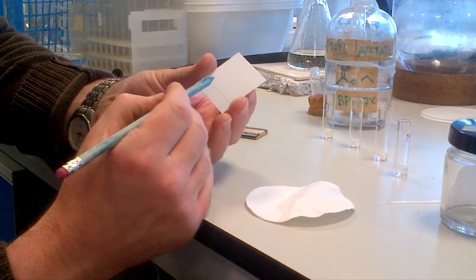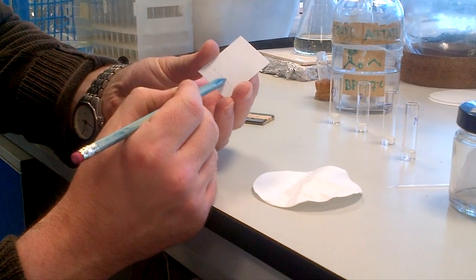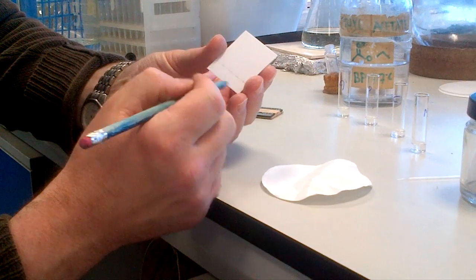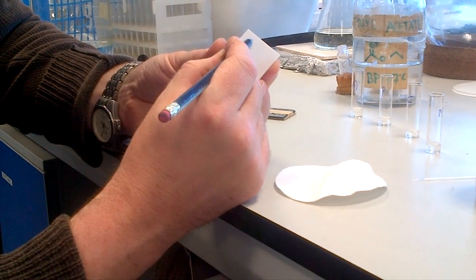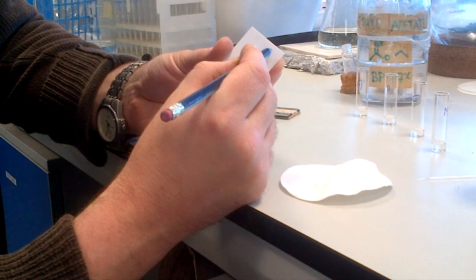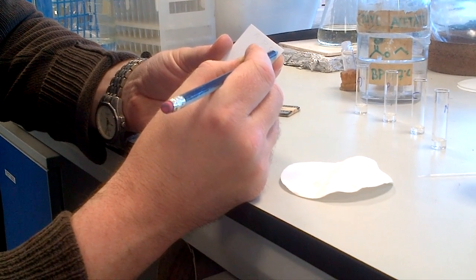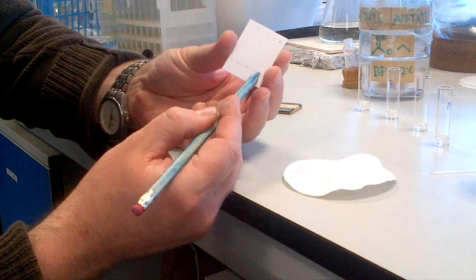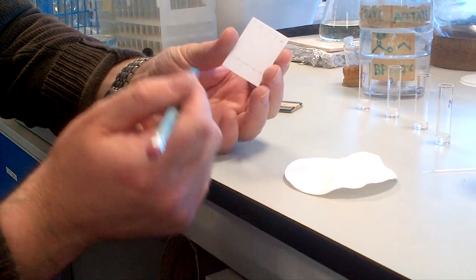You'll have two plates to do, and you'll need to mark four spots on each plate. You can spot clean aspirin, paracetamol, caffeine, and the mixture, placing each at the appropriate intersection on the pencil line.